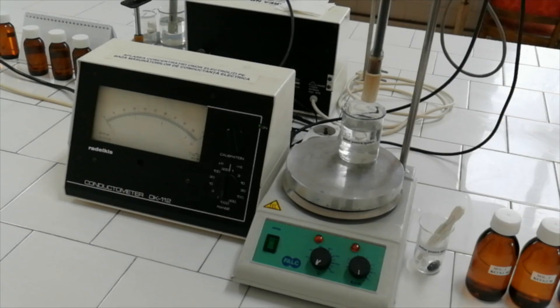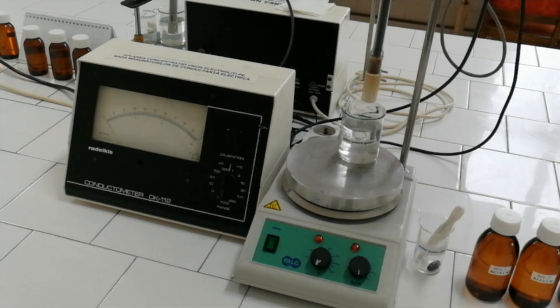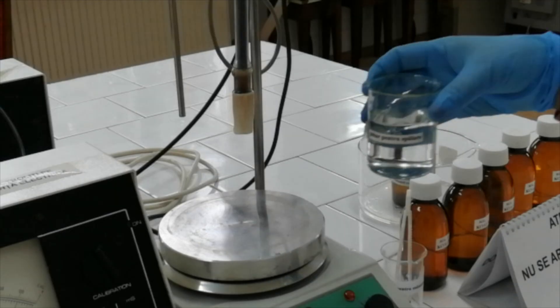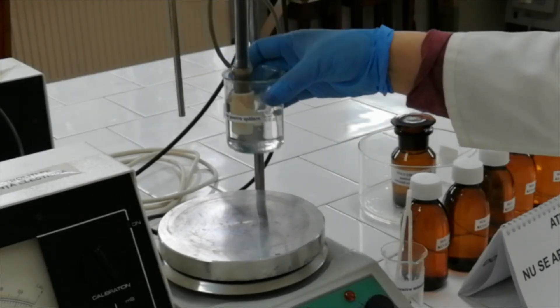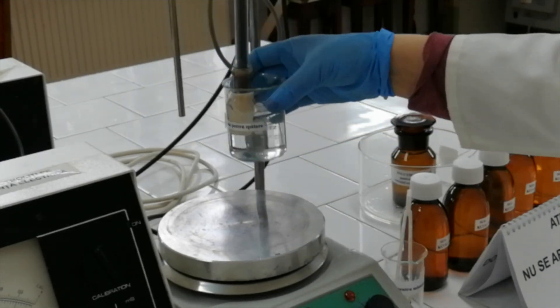Attention! Before any measurement, at the start and at the end of the experiment, rinse well the electrode, Berzelius glass, the magnet and tweezers with distilled water. Wash the electrode by dipping it into distilled water.